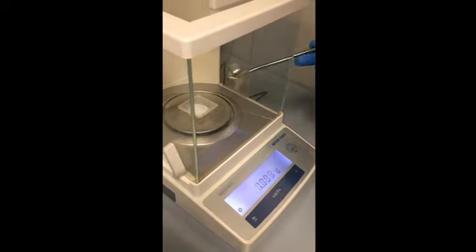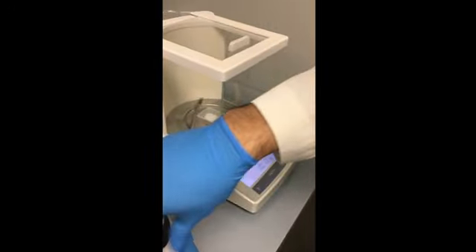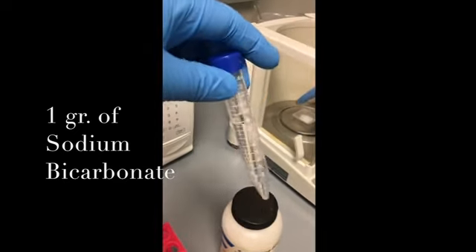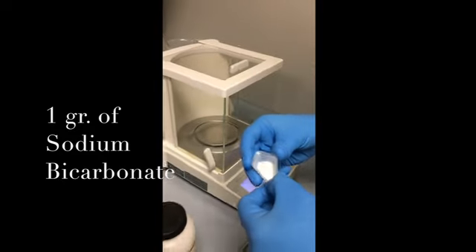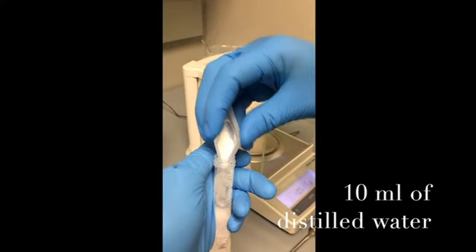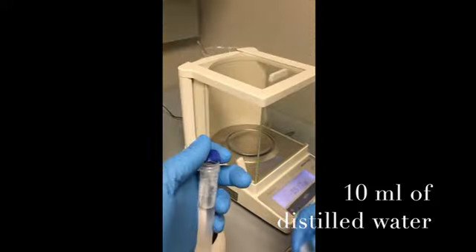So it is 1 gram of sodium bicarbonate for 10 milliliters of water. This solution is considered a weight to volume ratio. Just consider 1 gram of sodium bicarbonate in 10 ml of water, and that's what a weight to volume ratio is.